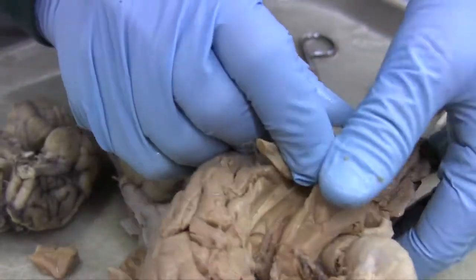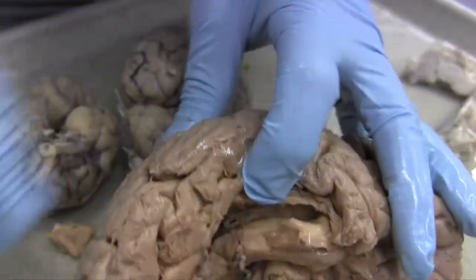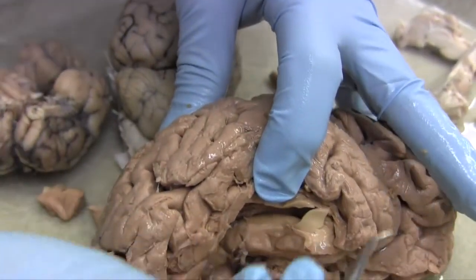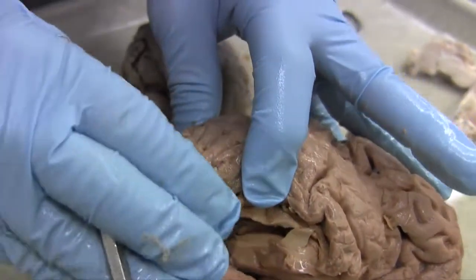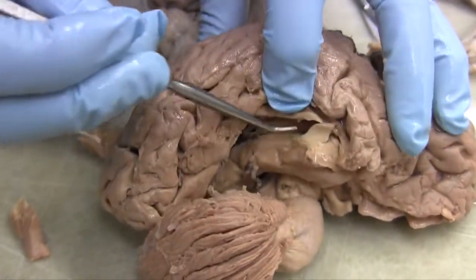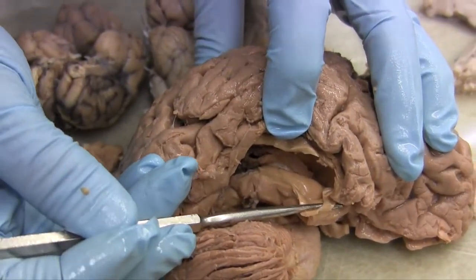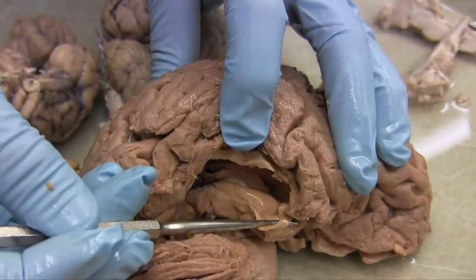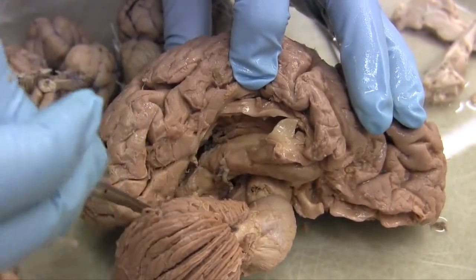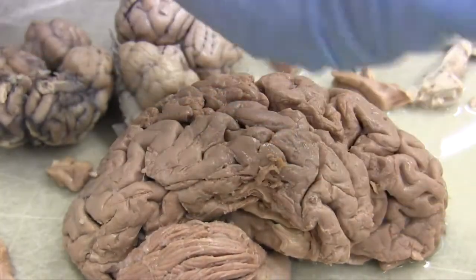So, what do we see? We see this ventricle going all the way up to the pole. This is the front of the temporal pole. Do you guys remember? This is the back, this is the front, cerebellum, temporal lobe, and there is the lovely hippocampus in the temporal pole of the lateral ventricle. So this lateral ventricle has gone like this. It sent a spur back here, and then it came all the way front here.